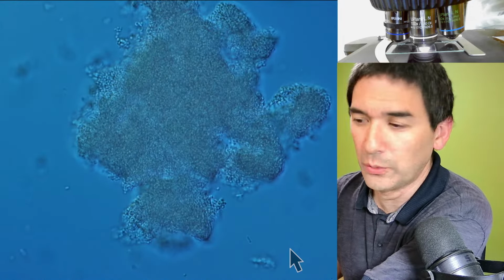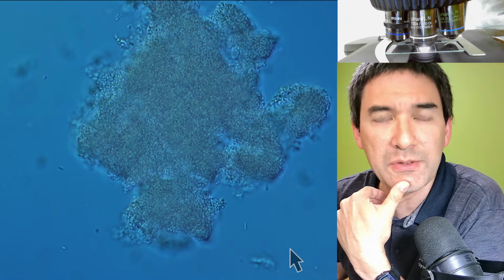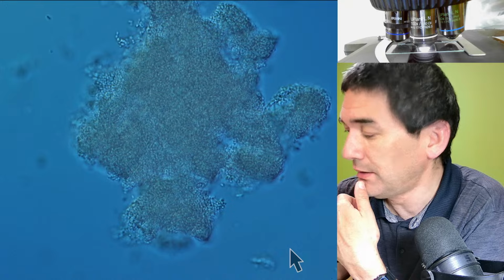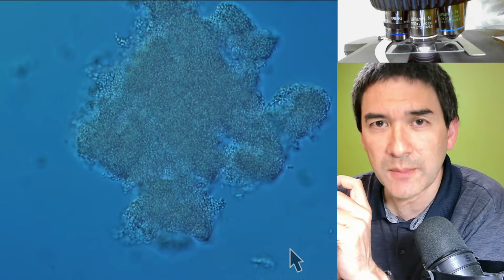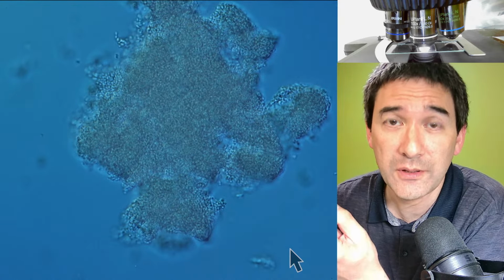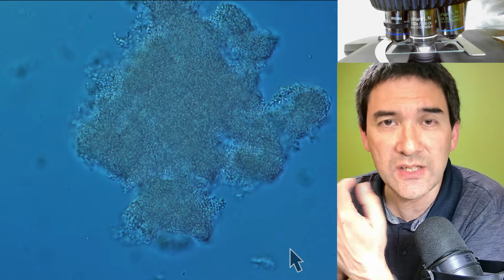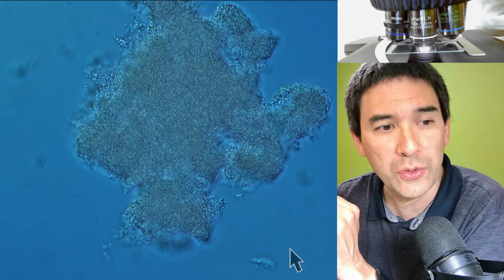So the thing is now the following, and this is where I would like to show you a little bit of heat fixing. Sometimes you want to stain the specimens, right? At university when we observed bacteria, there were sometimes staining procedures, for example gram staining, where we had to exchange the different stains. So there were multiple steps involved. And the question is, how do you do that? What we need is to have the bacteria fixed on the slide. And I'm going to show you how to do that.